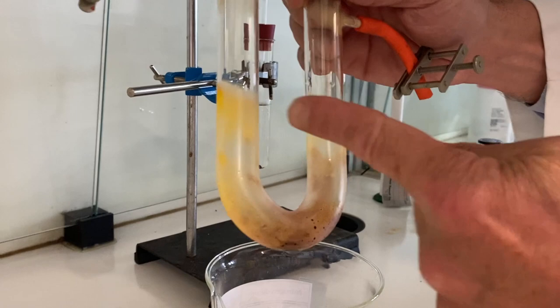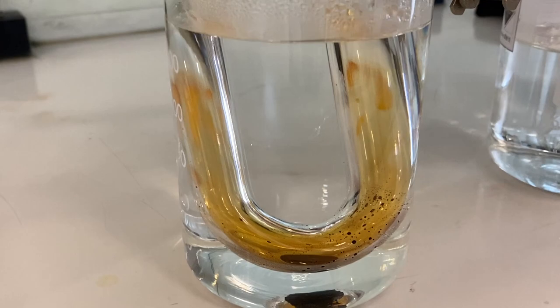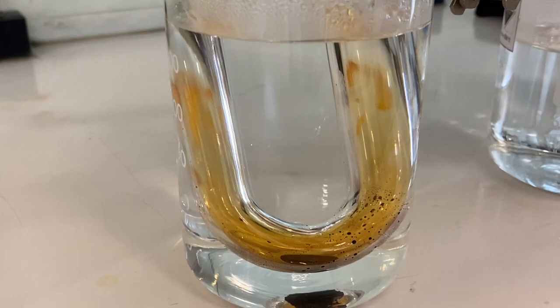The bottom's not so impressive. I can prove, but look, if I dunk that in there, that yellow will disappear very, very quickly indeed. Yeah, and the yellow's gone completely. So not quite so successful at turning it back. If I left it there for long enough, we certainly would get yellow forming. Or maybe add a bit more ice. Cool. Yeah, it takes a bit longer. There we are.